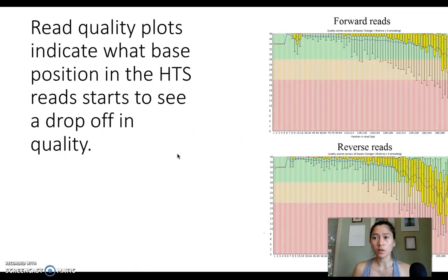Basically, read quality plots indicate what base position in the high throughput sequencing reads start to see a drop off in quality. I have on the right here an image which looks slightly different from what we look at in DNA Subway, but I think it illustrates some good points. Just like what we look at in DNA Subway, we have forward reads and reverse reads. The y-axis is a quality score, with a higher quality score meaning higher quality sequencing read that we are more confident in, and then the x-axis is the position of that sequencing read in base pairs.